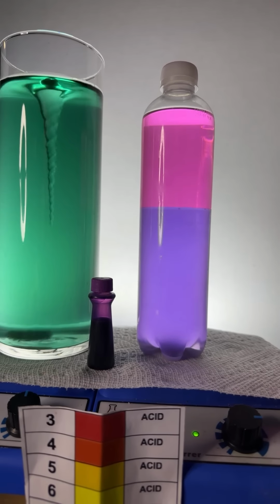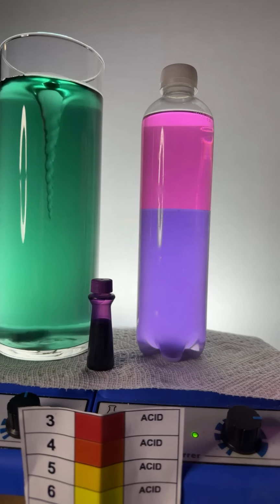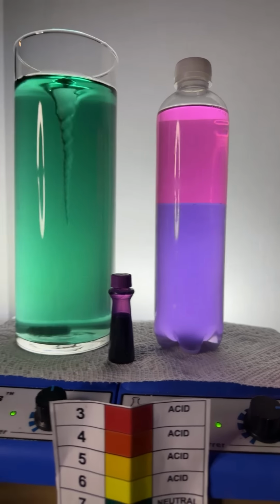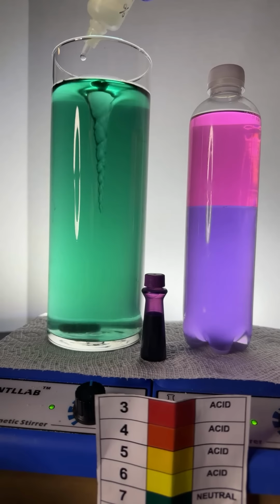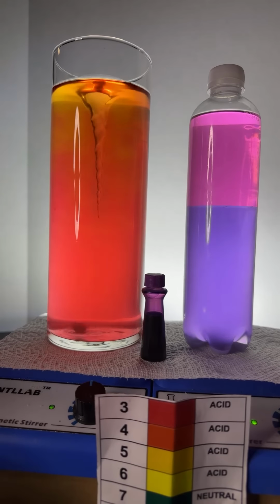I hope so. Now, this is kind of fun. I'm going to add a little bit of this to this bottle, and we're going to see what happens. Or we can do a different bottle, with different colors. I don't care. Oh, the eternal tornado. Let's do something with the tornado here. Let's add a little bit of acid here. Drop the pH. I don't have any iodine, Future Farm, but what a great suggestion.